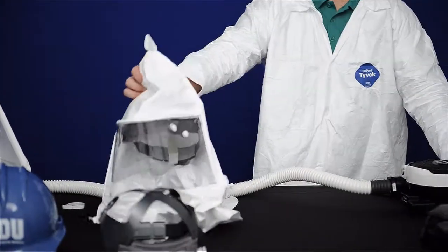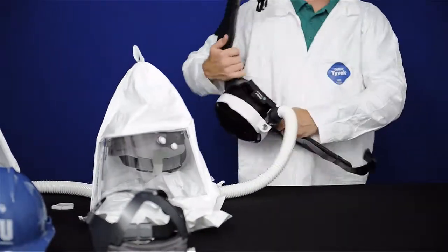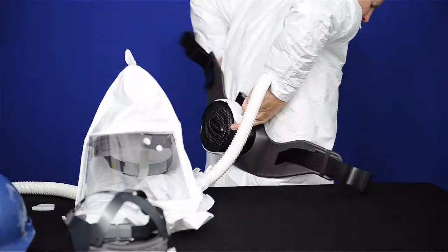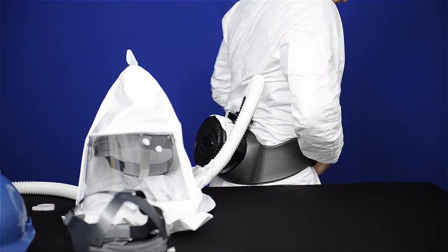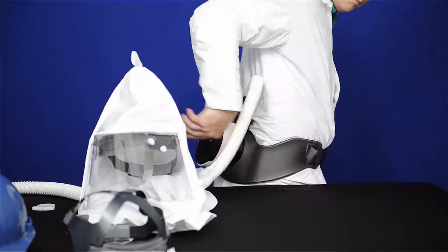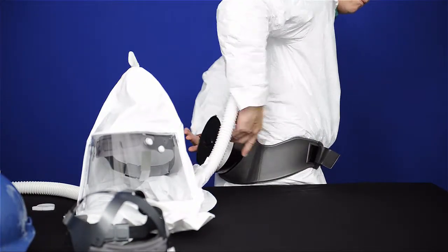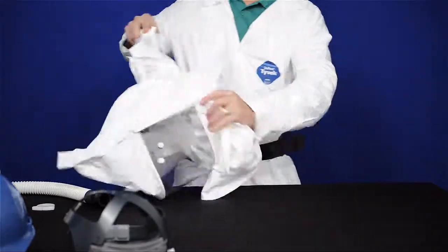Buckle the PAPR to your waist. Turn the blower on and pull the hood onto your head.